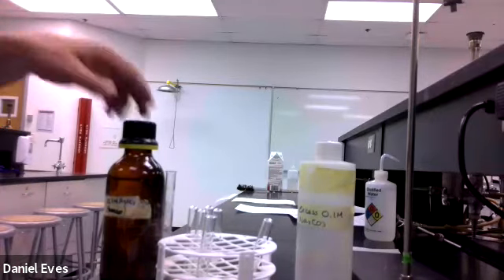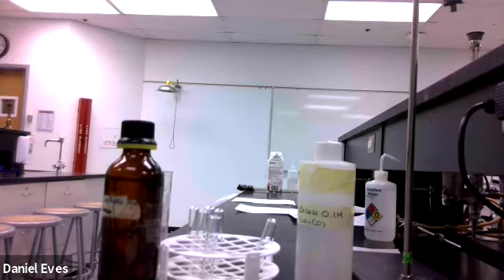Welcome. We are doing Equilibrium Lab, and so initially, if you were here with me, we would have you make the solutions that we would be using today. There are 4 solutions that we need: silver nitrate, sodium carbonate, copper sulfate, and cobalt chloride. So you would make those solutions.